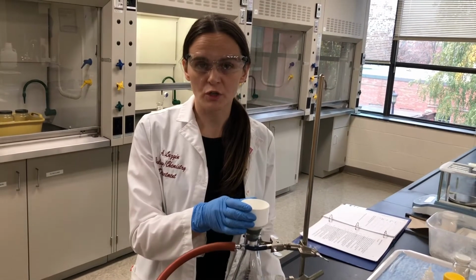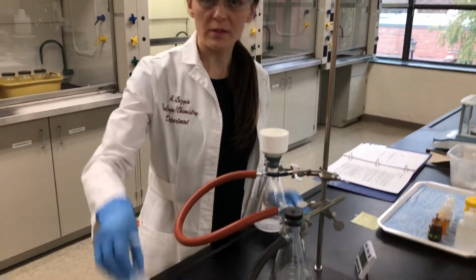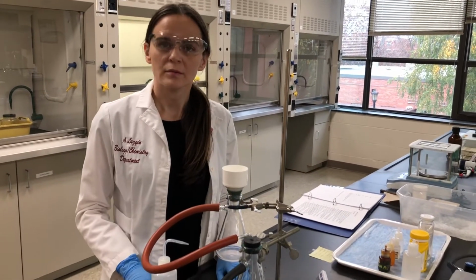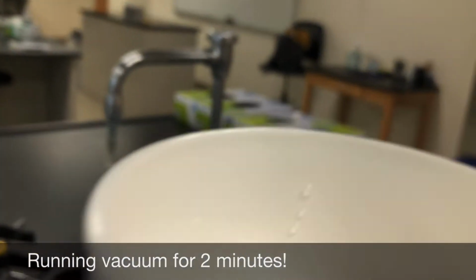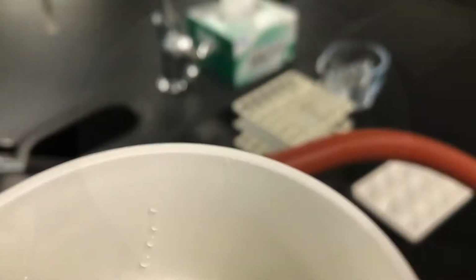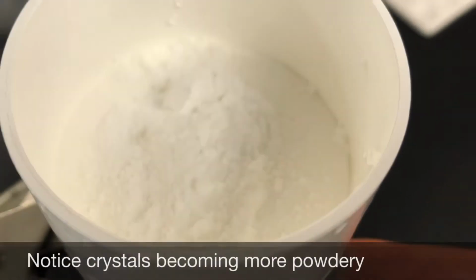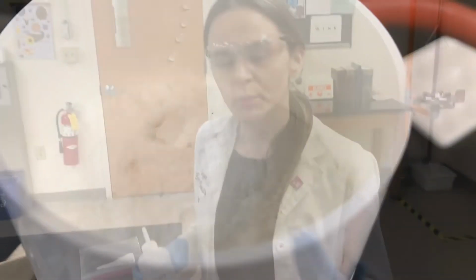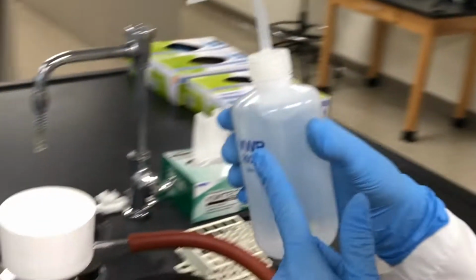For the vacuum filtration to proceed for 2 minutes. After the first 2 minutes are up, I'm going to rinse the crystals to remove any impurities, specifically acetic acid, by spraying water all over the crystals. Again, I'm using my ice cold water.